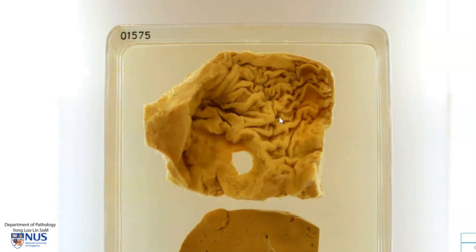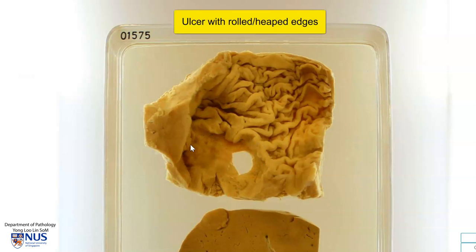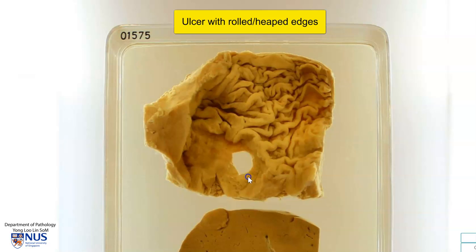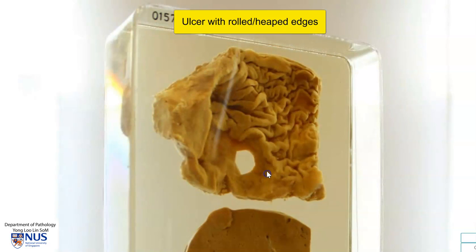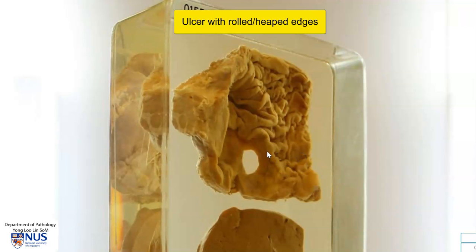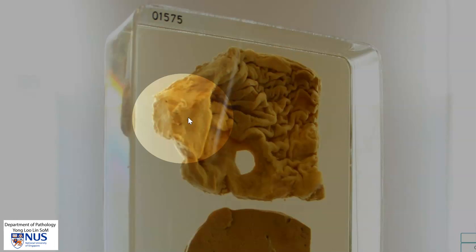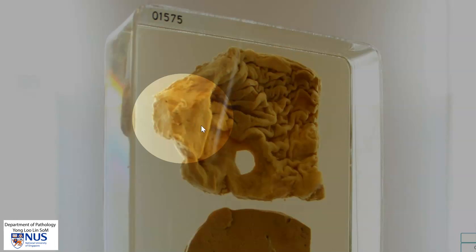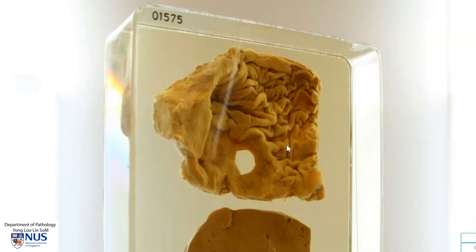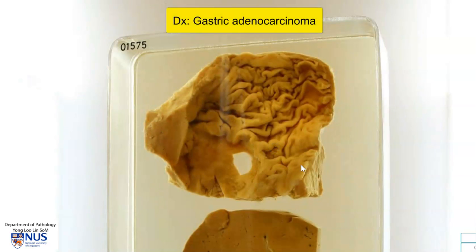This is the mucosal surface of the stomach. And we can see that there is a large irregular ulcer with rolled edges. And if I turn this slightly at an angle, we can actually appreciate that the edges are rather thick and heaped up. We can also see in this region that the gastric wall is significantly thickened, and this is because it is infiltrated by malignancy. The diagnosis here is gastric adenocarcinoma.